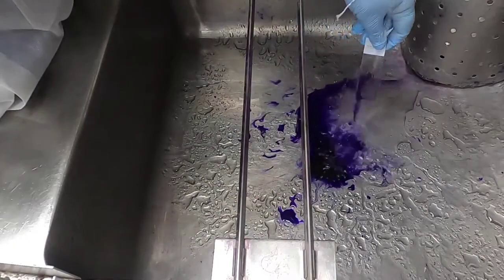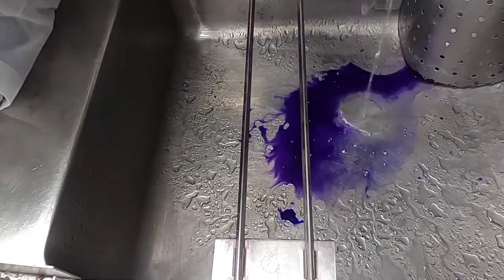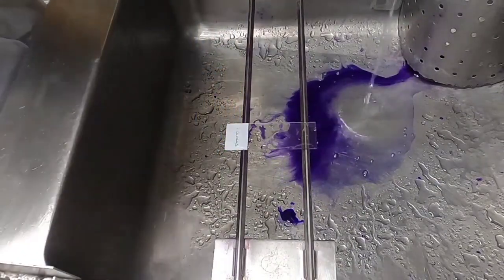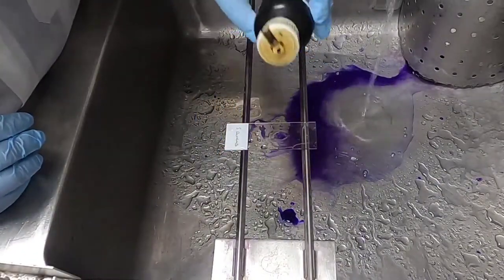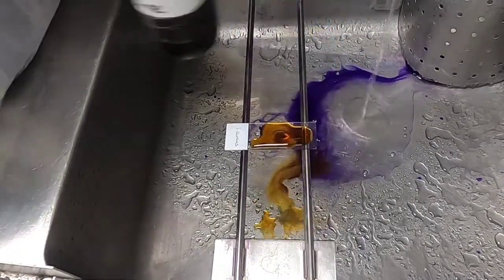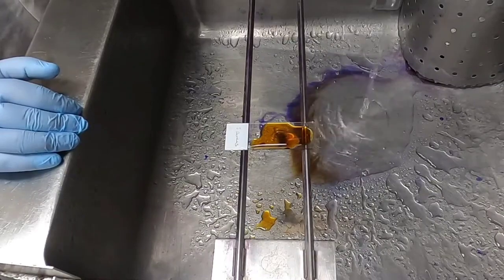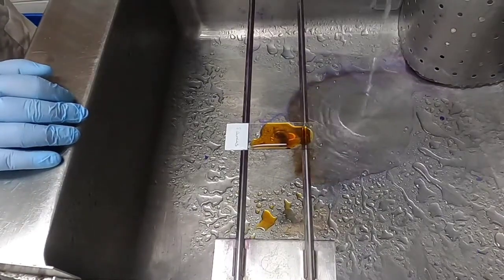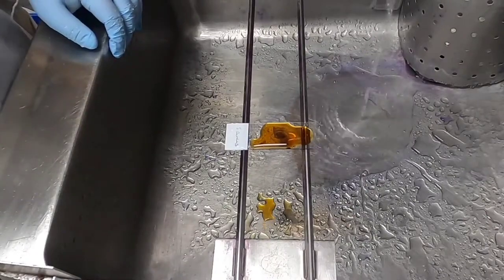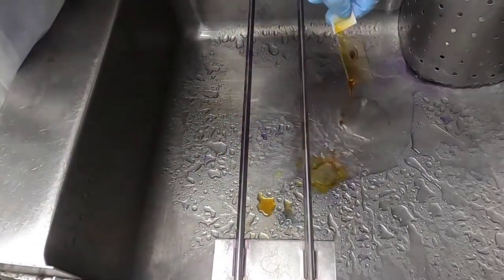After a minute, rinse off the stain in the sink and apply Gram's iodine, which helps to form crystal complexes of dye within the cell wall. Just like the crystal violet, leave the Gram's iodine on for one minute, incubating at room temperature, then rinse in the sink as before.